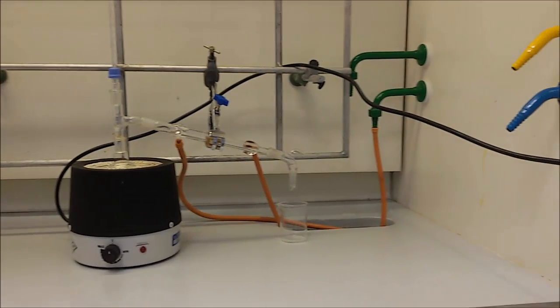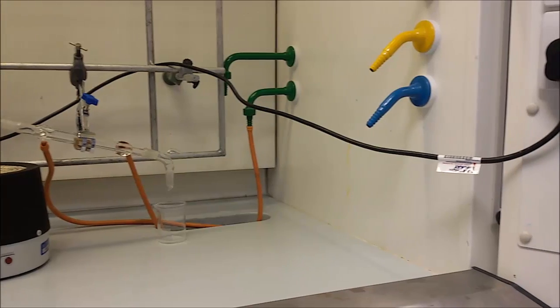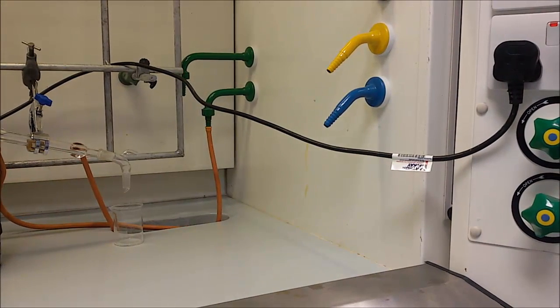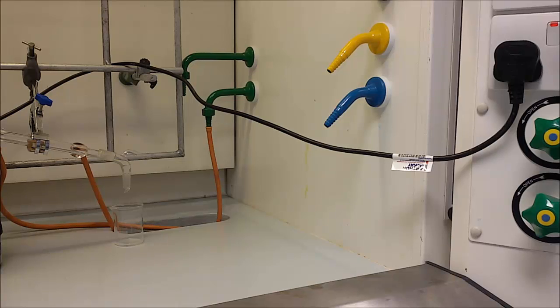Check if everything is tidy and safe in the fume hood. Pay particular attention to the tubing and electricity cable that has to be behind the distillation setup.